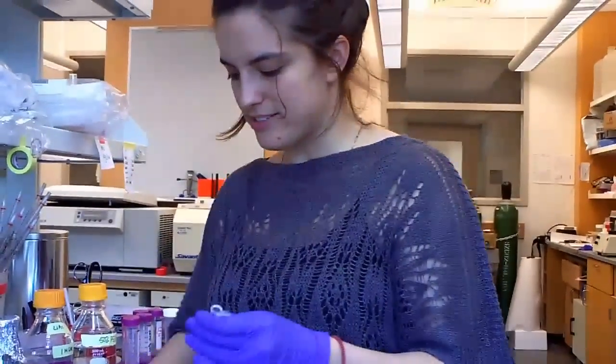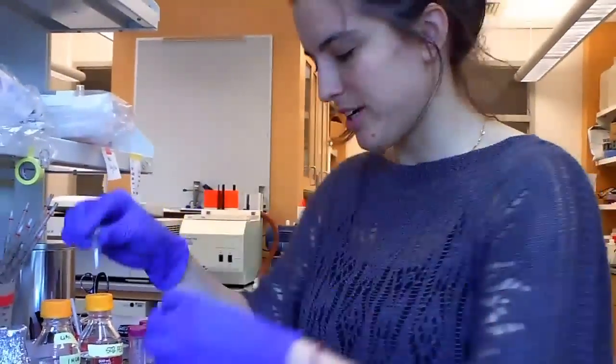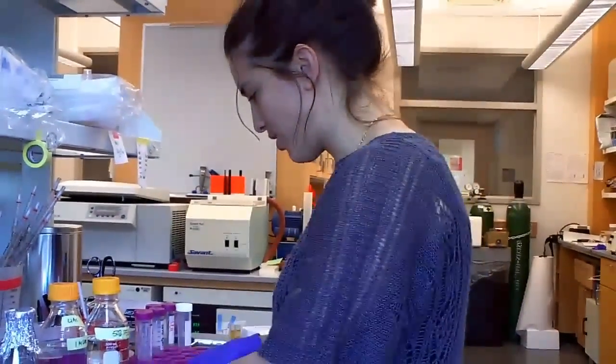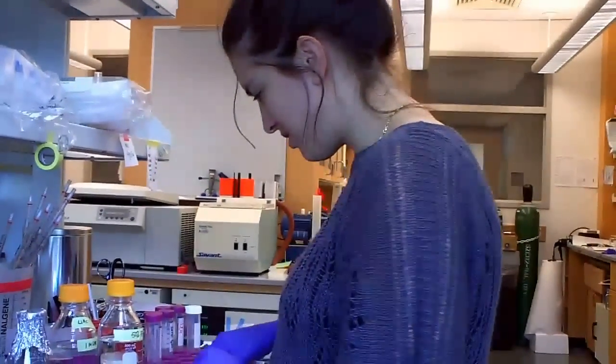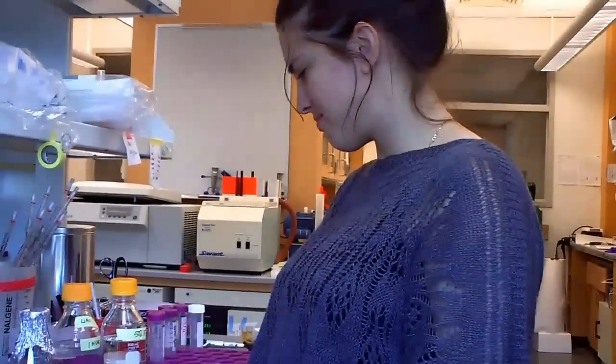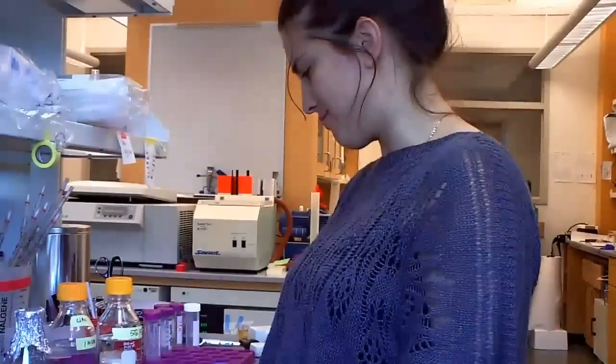Okay. So now we have just cells in the bottom, and they've been washed a couple times, so now we're going to resuspend them with the mixture. And it says vigorous vortex mixing.